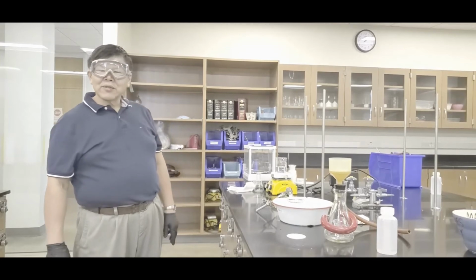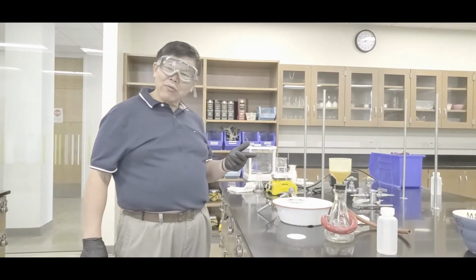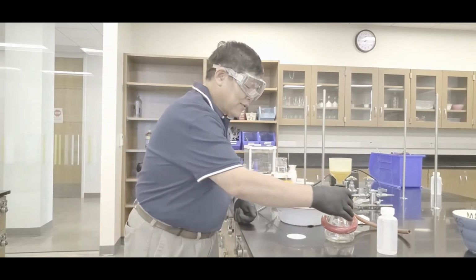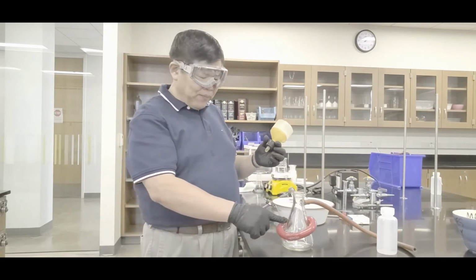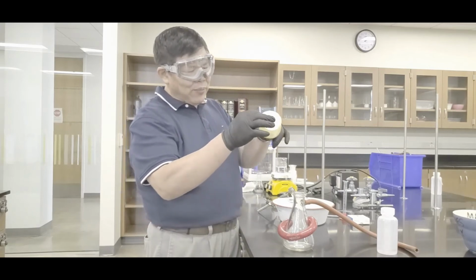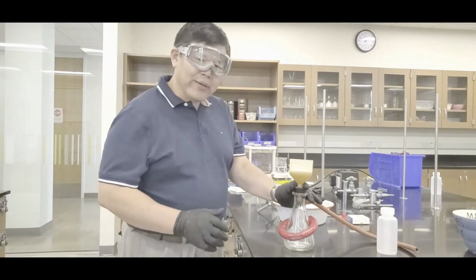All right, class. While you guys are waiting for the aspirin to crystallize out, test your filtration flask. So what you want to do is this. You've got your filtration flask right there, the donut, and the Buchner funnel. Now what I want you to do is just park the filter paper flat in there.